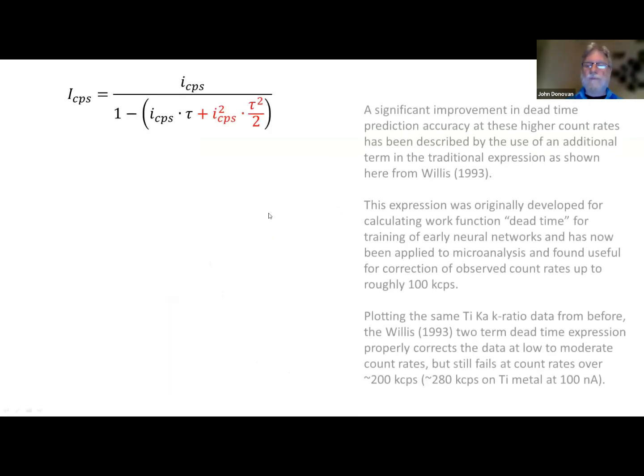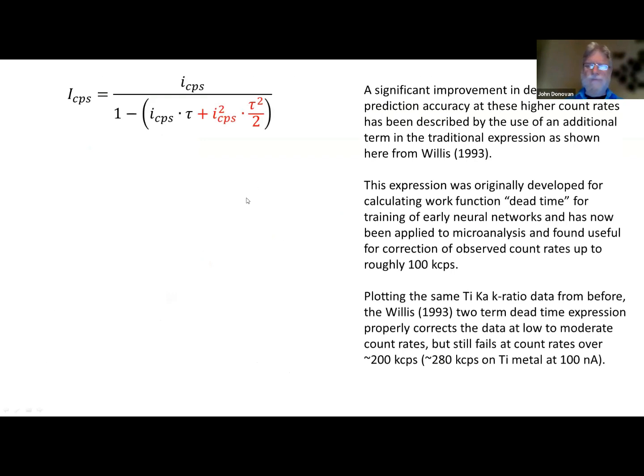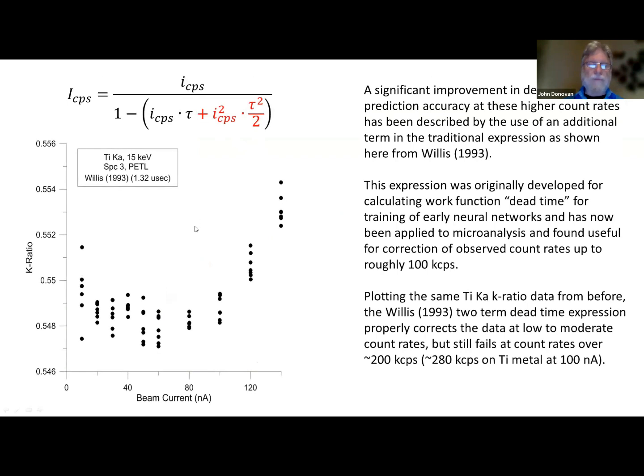What we need to do is go nonlinear. And here's an expression that I found from the 1990s, published actually in a neural net paper, and they have dead time in neural networks, and they said, okay, let's just take this dead time correction and add this nonlinear quadratic term. And when we apply that to the data, it's flat now out to about 100,000 counts a second. So we've now doubled the useful range of our instrument. That's pretty cool. Okay, so let's keep going.